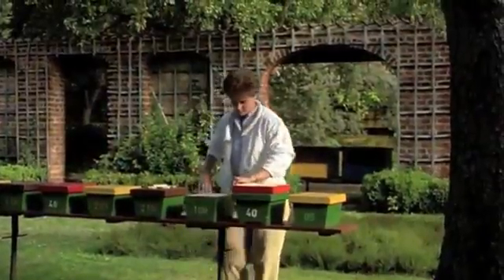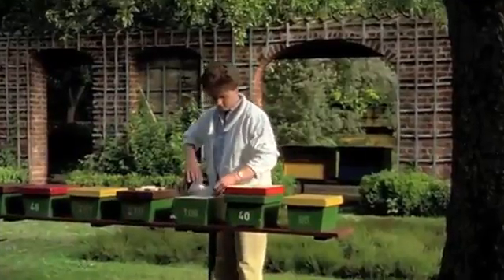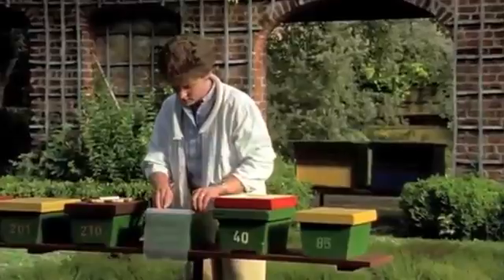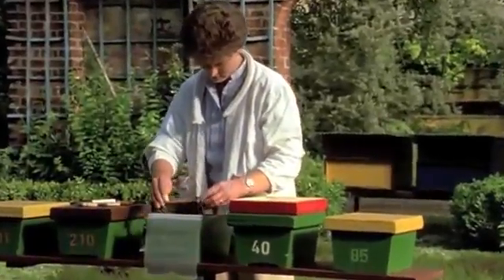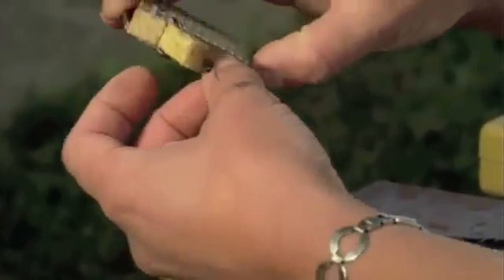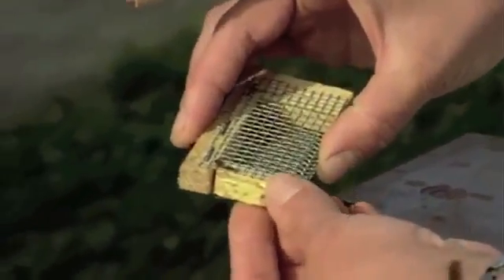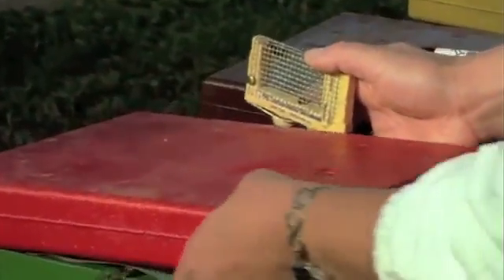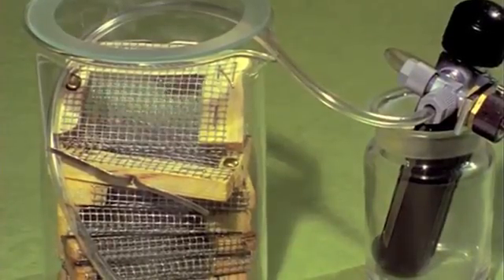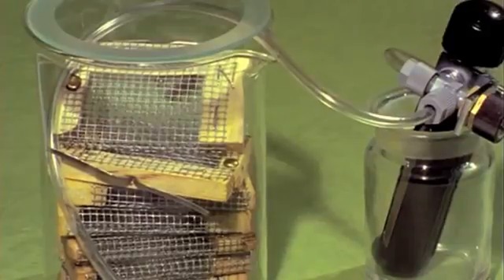At six days, the queen is sexually mature. On the day before insemination, the queen is caged so that she can be later narcotized with CO2 in the laboratory. This treatment takes about five minutes and helps to accelerate the onset of egg-laying.